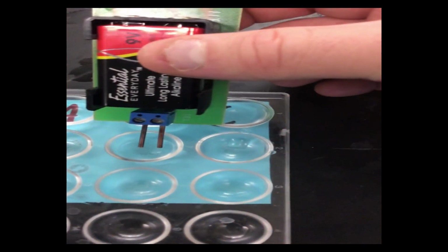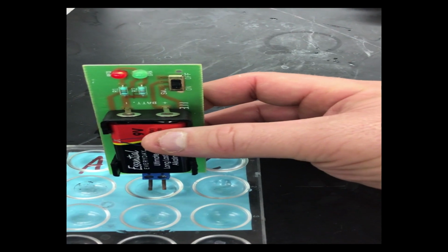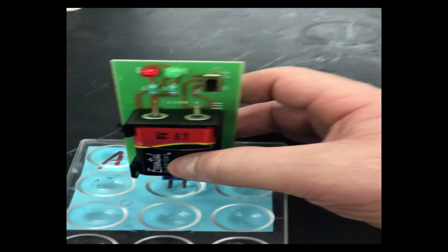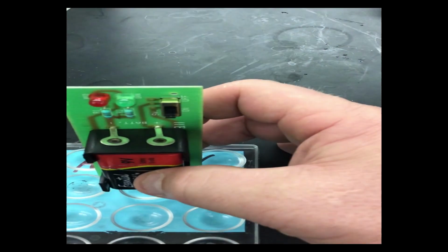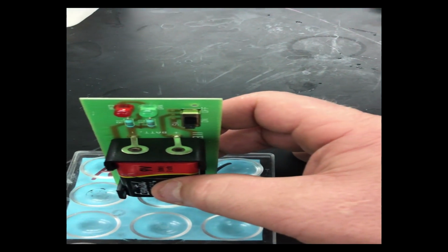So we're going to start by checking that and its conduction. So we put this in distilled water, and we notice that with the distilled water, we get a little bit of that red light to light up. See how that just changes just a little bit there? So even our distilled water has a little bit of ions in it that we can't get rid of, okay?